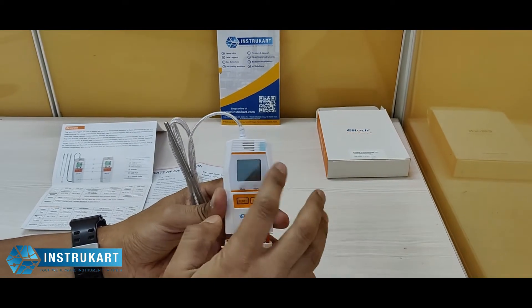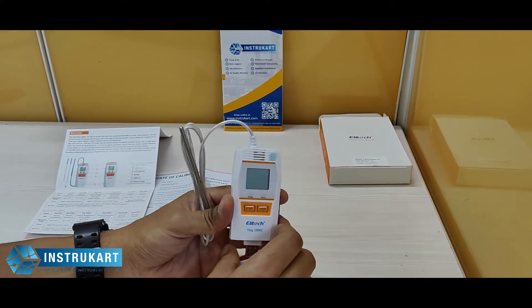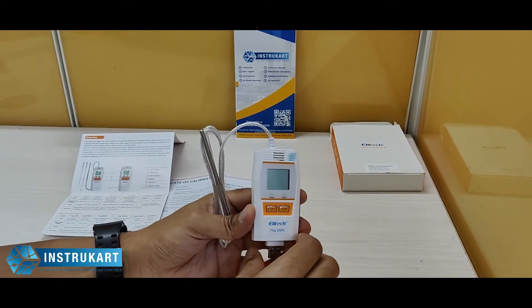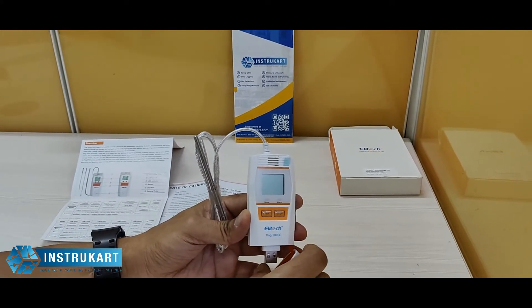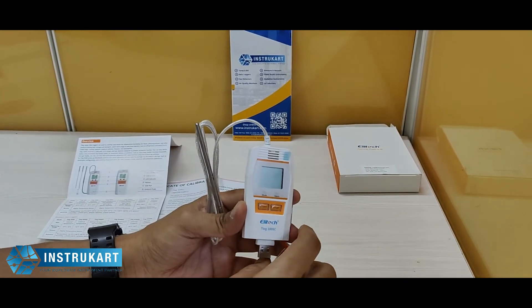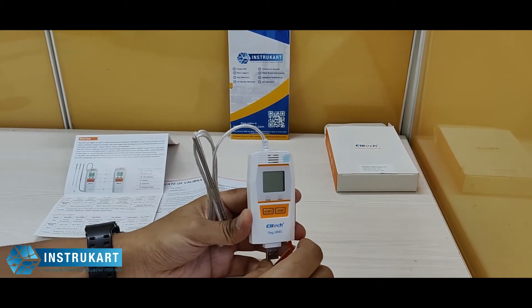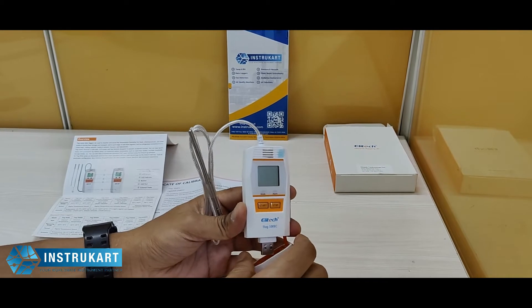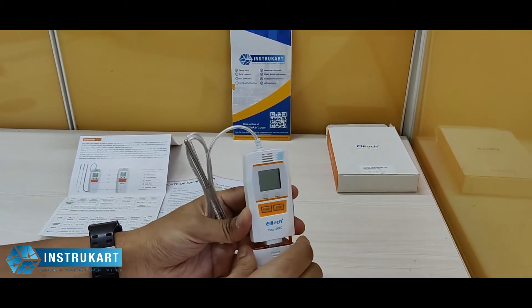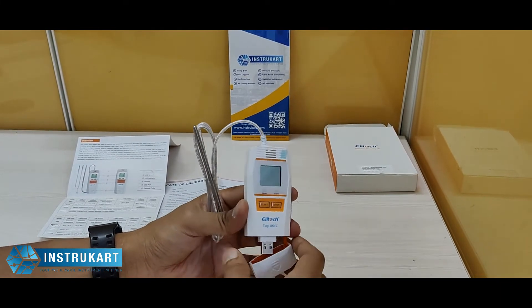It has a display so while the data logger is running you can always see the current temperature. It has a temperature accuracy of plus or minus 0.3 degrees Celsius between minus 20 to 40 degrees, plus or minus 0.5 degrees between minus 50 to plus 85 degrees Celsius, and plus or minus 1 degree accuracy between minus 100 to plus 100 degrees Celsius, and plus or minus 2 degrees for other temperature ranges.